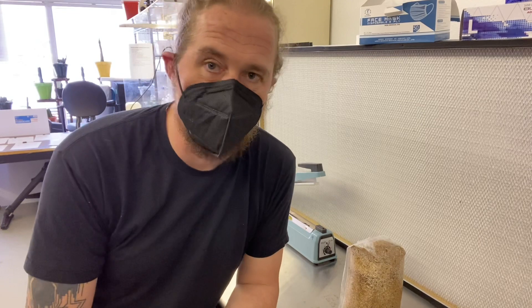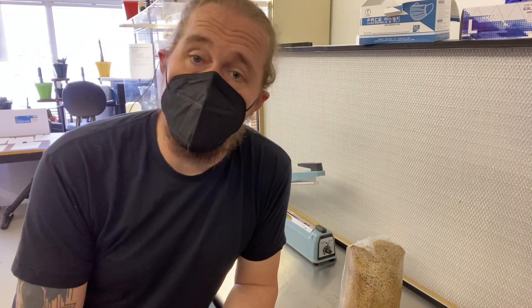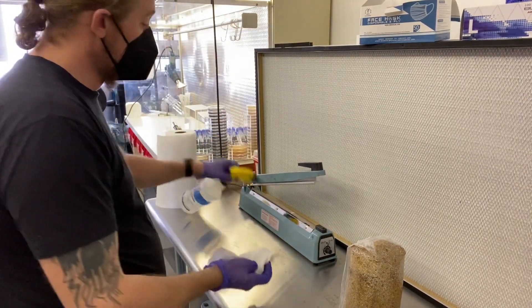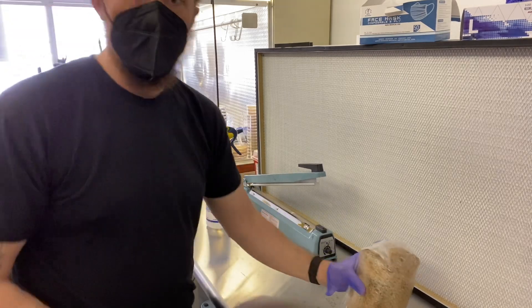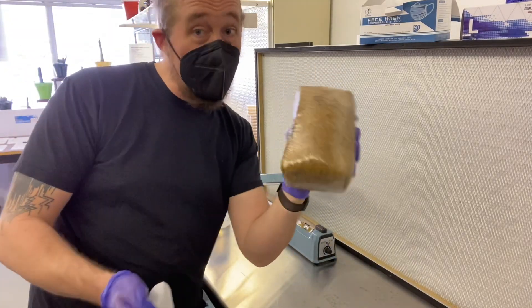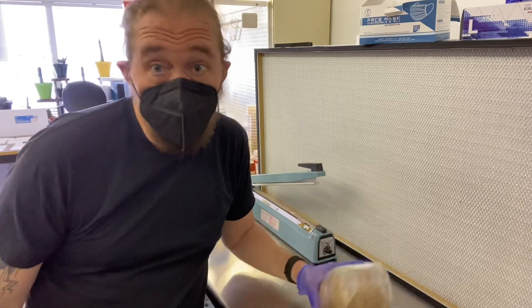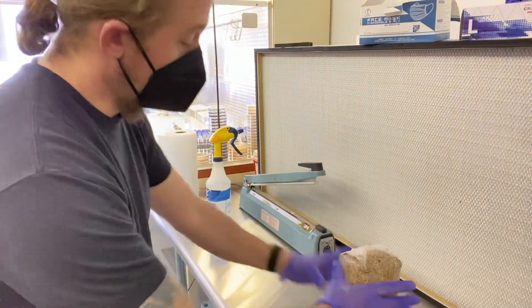Here's the problem — it's been cooling overnight. It's been collecting water and moisture and condensation on the outside. So, even though it's been sitting in front of a flow hood, all that does is ensure that the air it sucks in is sterile. It doesn't prevent some rogue amoeba flying in on that moisture and landing on the outside of the bag. Now, I'm going to take this iso rag, and before I do anything with this bag, I'm going to wipe it down. Now it's sterile. This is sterile. I'm sterile. Now I can work.